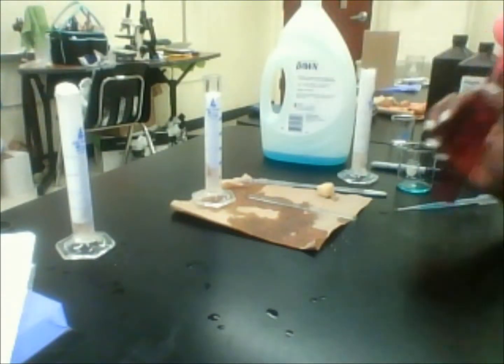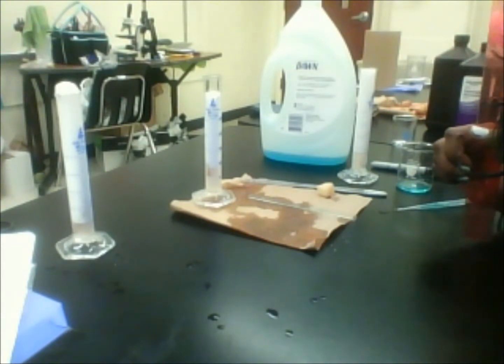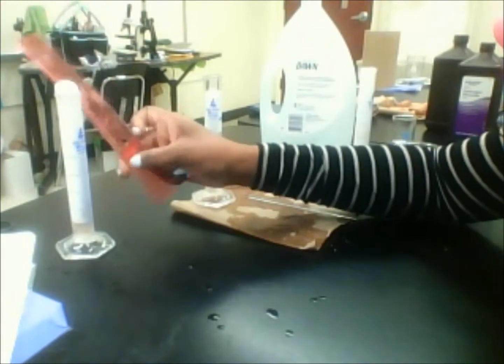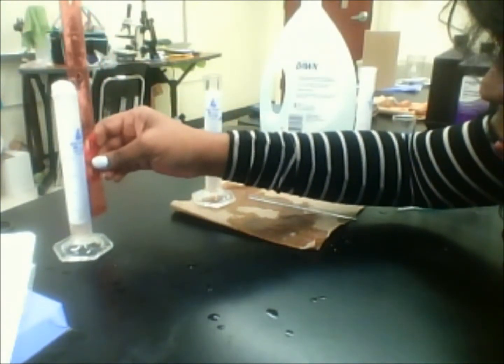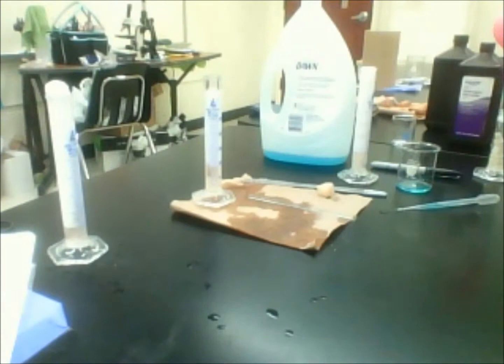And then the last one, I told you, and this one is all coming over top of the graduated cylinder. Have about 7 seconds. Alright, and this one, it's going to measure to be about, and again, I just do it from the base. This one is about 15.3 centimeters.